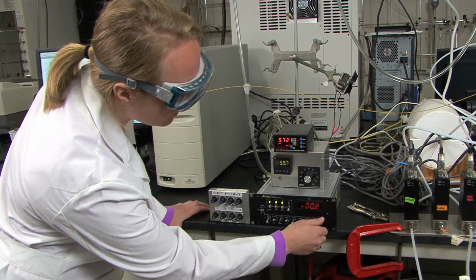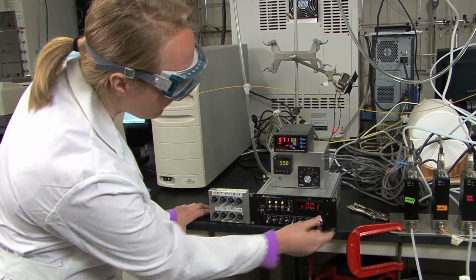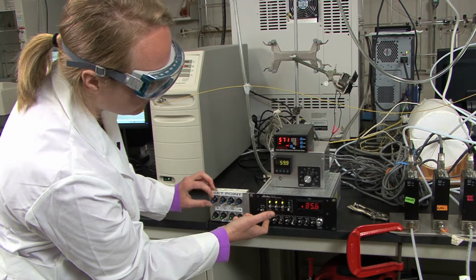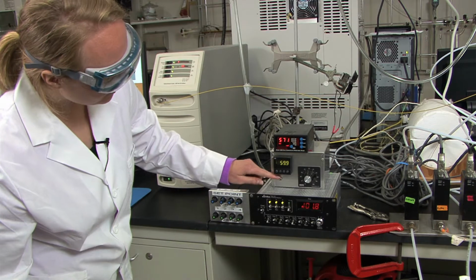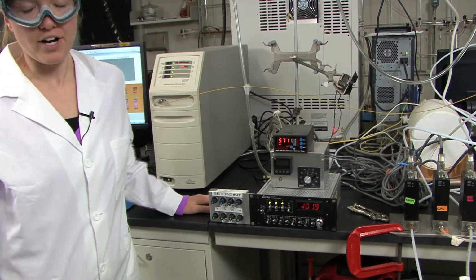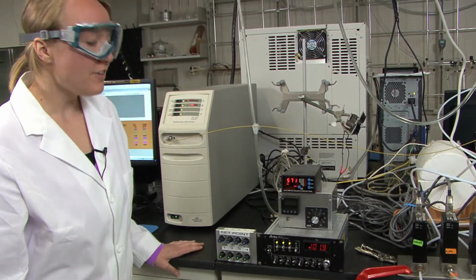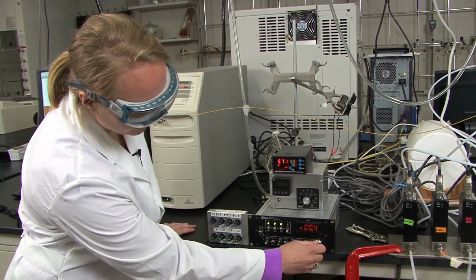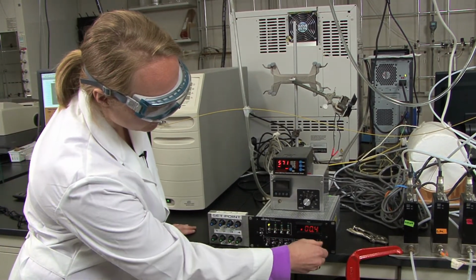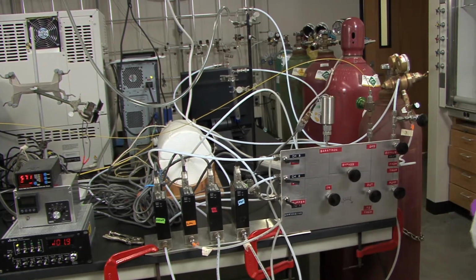Oh, and you'll need to turn the dial so you can read that. And then set the argon flow rate back to 100. Oops. And you can turn off the temperature reading at this point because you're just doing an argon purge. And you'll want to collect that scan and save the data as well. So at this point, you should have 0 flow rate for the oxygen and the ethylene, and you can turn those 2 channel readouts off, and you can flip the switches or the toggles for 2 and 3, and then turn off those gases.